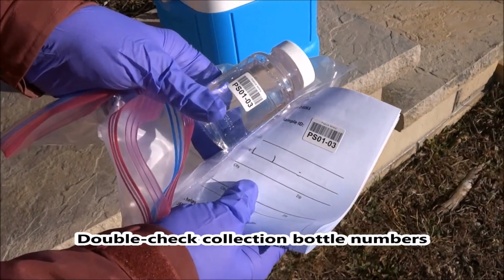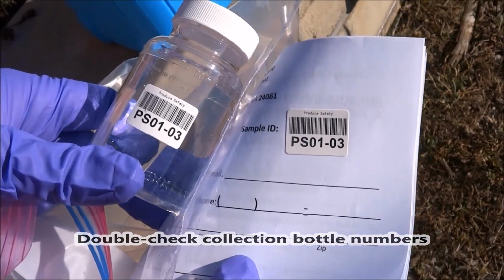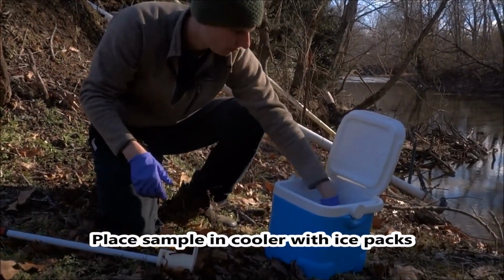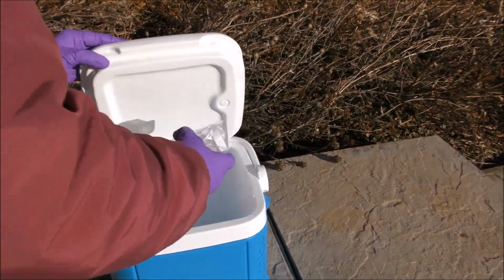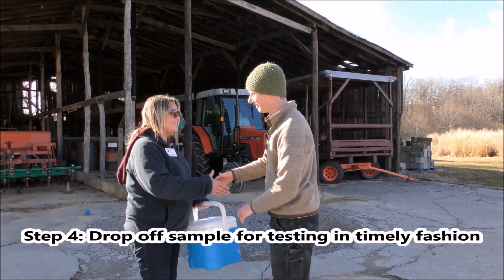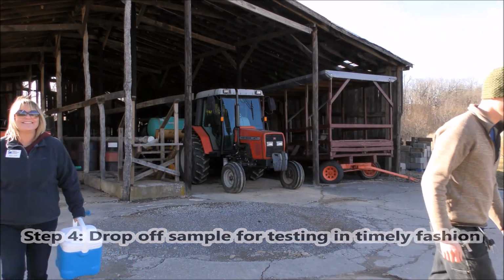After collecting your sample, compare the collection bottle number to make sure that it matches the questionnaire number label. Place the collection bottle in the Ziploc bag, seal the bag, and place in a cooler with ice packs. It is important that the sample be kept cold until it is analyzed in the lab, but make sure the sample doesn't freeze. Remember, bacteria testing is time sensitive, so drop off your sample at the designated drop-off location so it can be processed in a timely fashion.